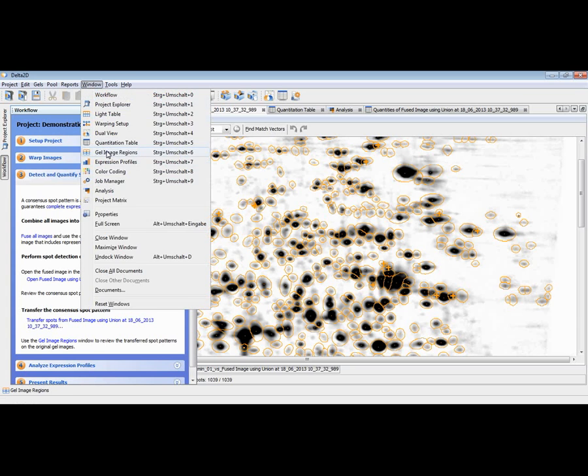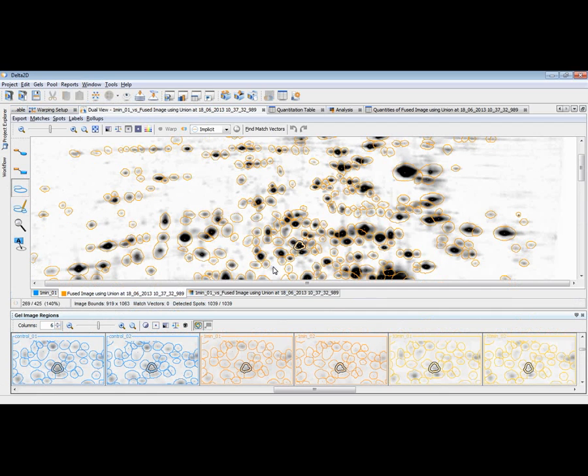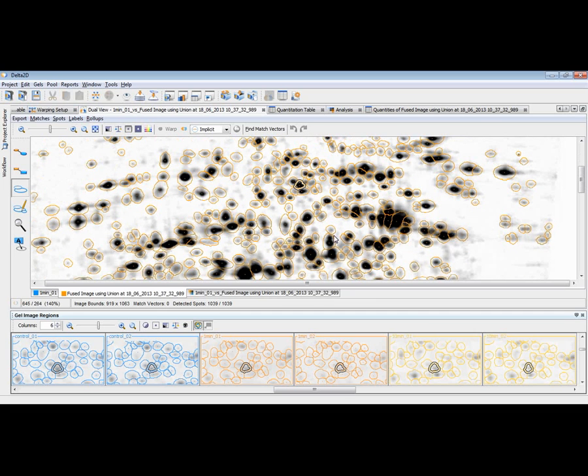This is done already. And once we have done this, we can now also, of course, at any point in time have a look at the gel image regions, where we see the same region across all the images. And if you are in doubt whether a spot on the fused image is 1 or 2, you can also use this gel image regions view.